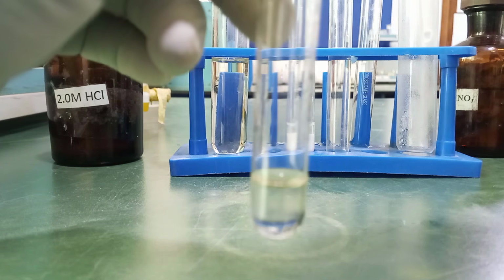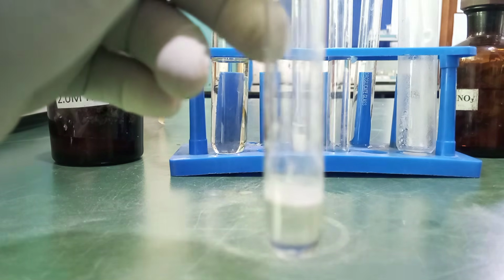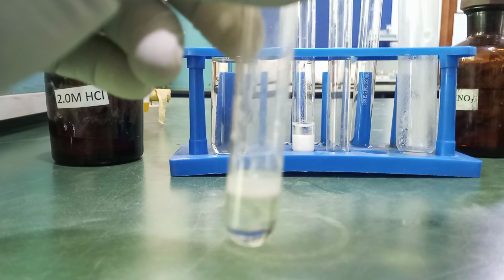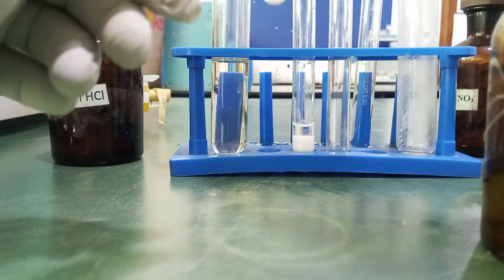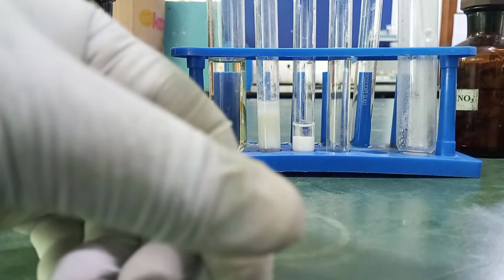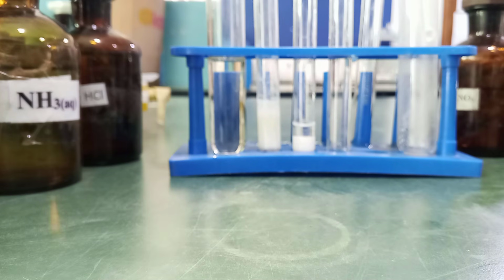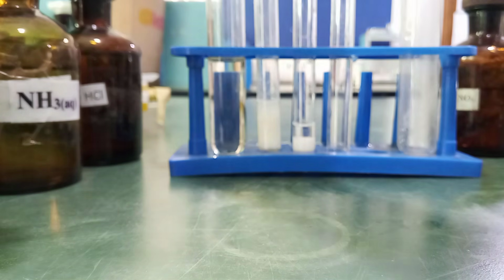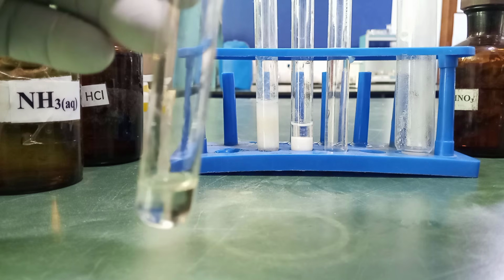Excess. Yes, white precipitate in drops, and also in excess. All right. But let's even confirm whether there's a confirmatory test that we can use to confirm whether lead(II) ion is actually present without necessarily using HCl. We can use potassium iodide, although this is not part of the requirement, but I just had to bring this in to confirm to us that what we are working with is lead(II) nitrate.